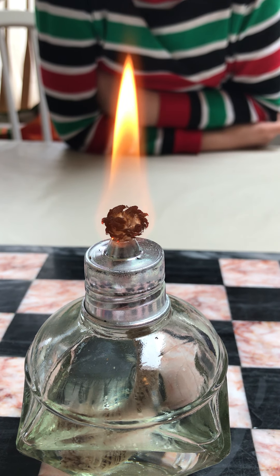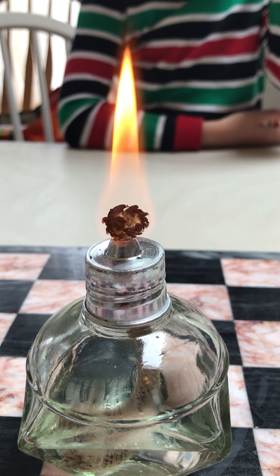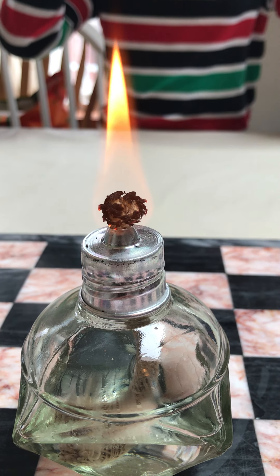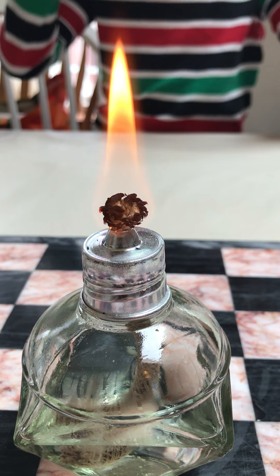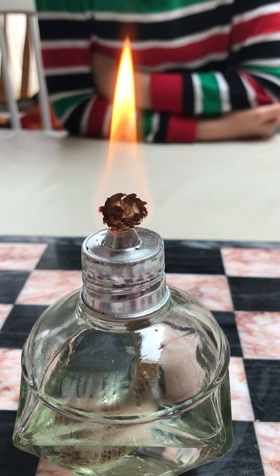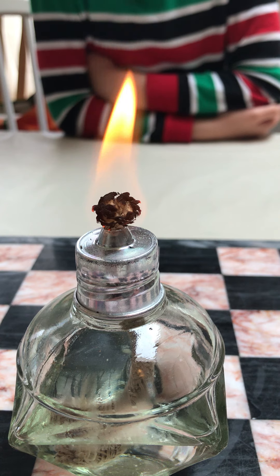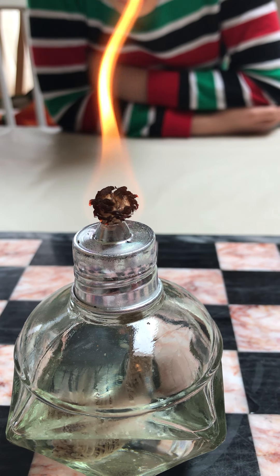Hey ladies and gentlemen, it is time for our first fiber identification test - the flame test. We're going to observe the fiber as it approaches the flame: does it curl away, melt, or ignite? Then we observe the fiber once it's been put into the flame: does it catch fire, burn all the way back, go out, or just melt? Finally, we look at the residue - what does the ash look like? Is there any residue? Is it plasticky or hard?